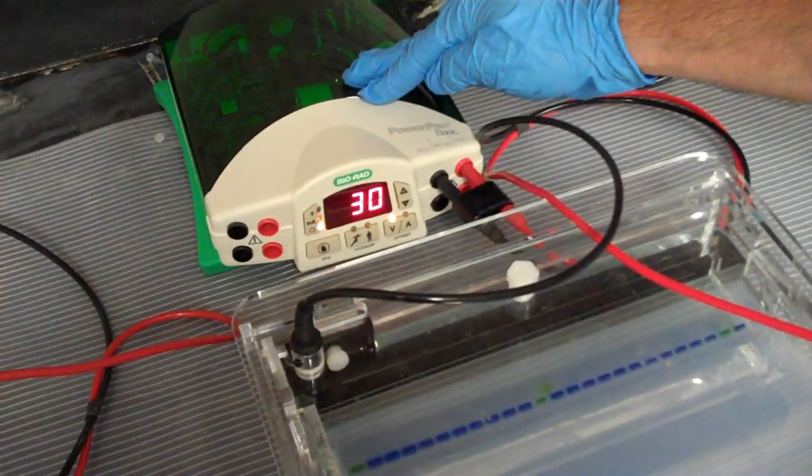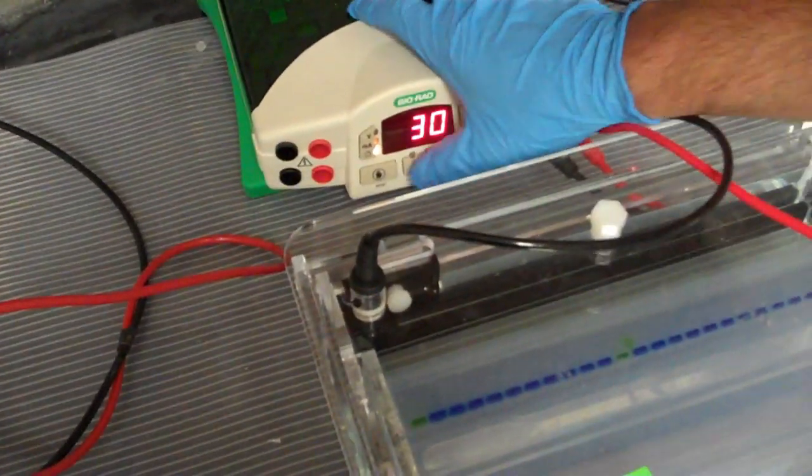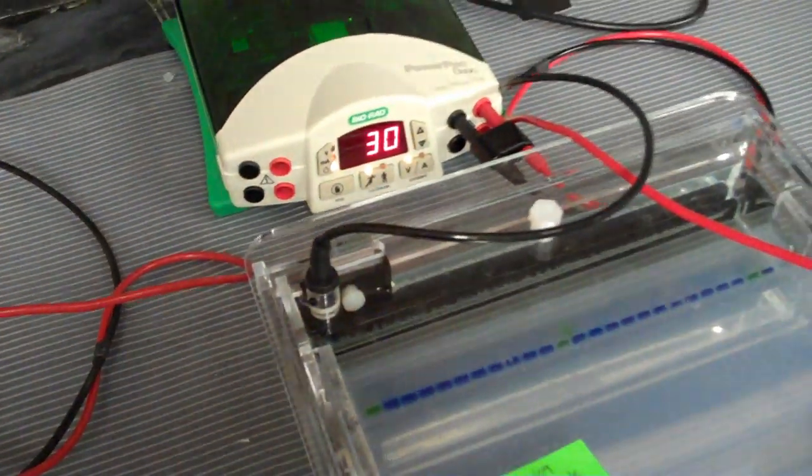Now you're ready to begin. Push the running man button at the bottom. Take a look at the bottom and the top of the machine.